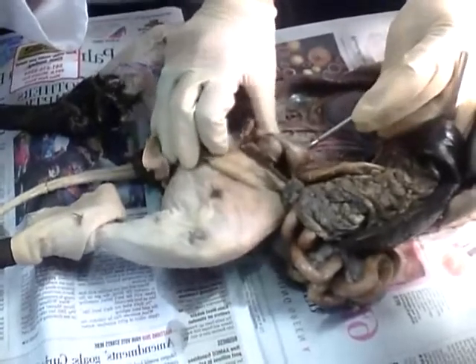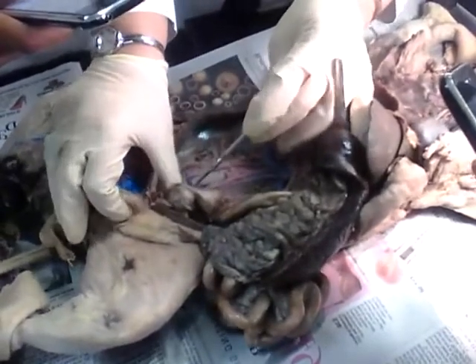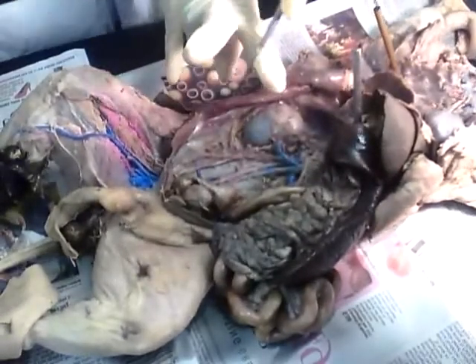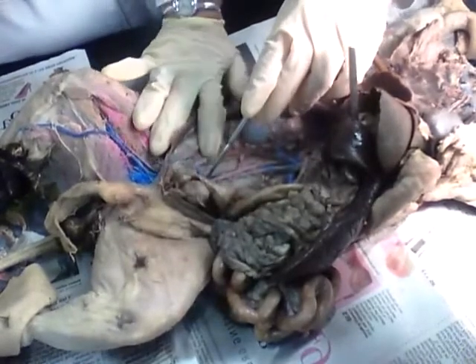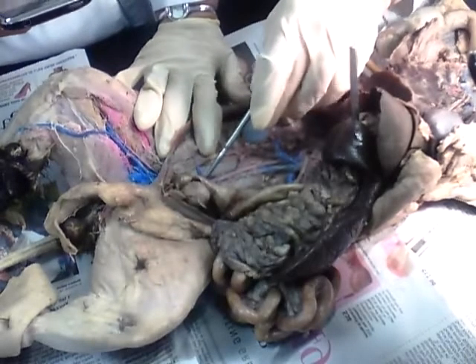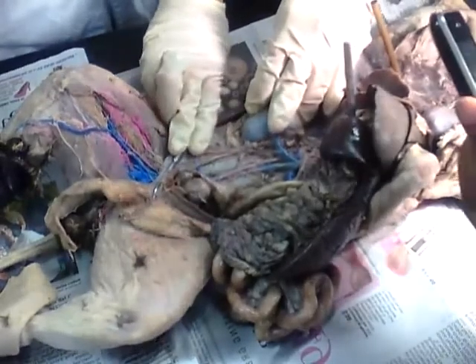Then these go into the lower back, and they're going to be called iliolumbar. Very good. Then it comes to a point where the aorta branches out or bifurcates, right? It forms this V shape. What's the name of this? External iliac. And then we're going to have the internal iliac. Once the external iliac passes the inguinal canal or the groin, it's going to change name. What's it going to be called now?